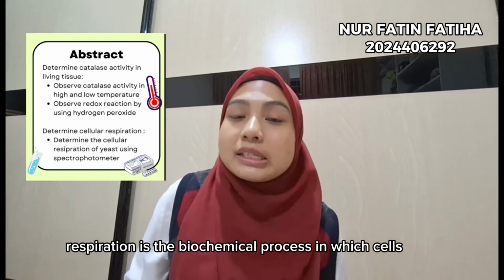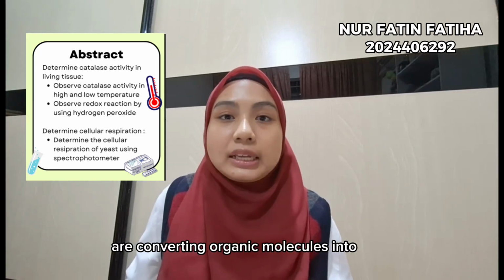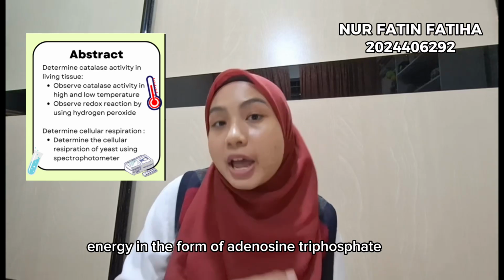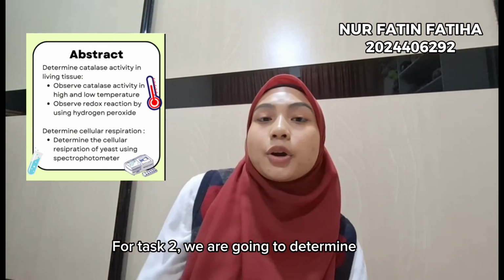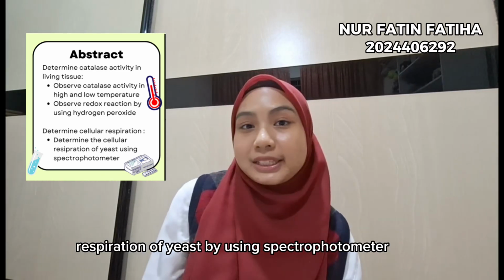Hi, we are from Group 1 AS2111A-1 are going to present cells mini project. Cellular respiration is a biochemical process in which cells are converting organic molecules into energy in the form of adenosine triphosphate. For task 2, we are going to determine the cellular respiration of yeast by using spectrophotometer.